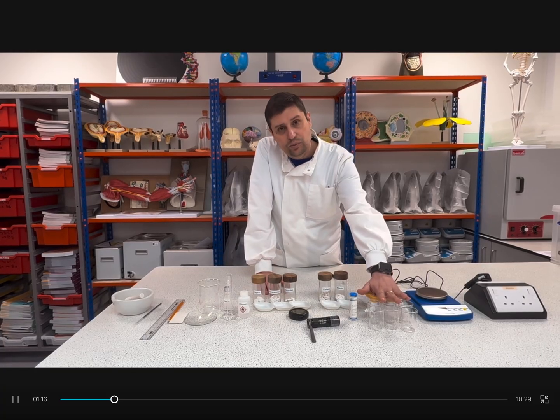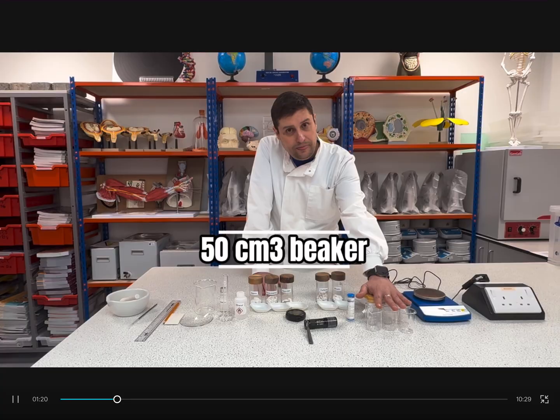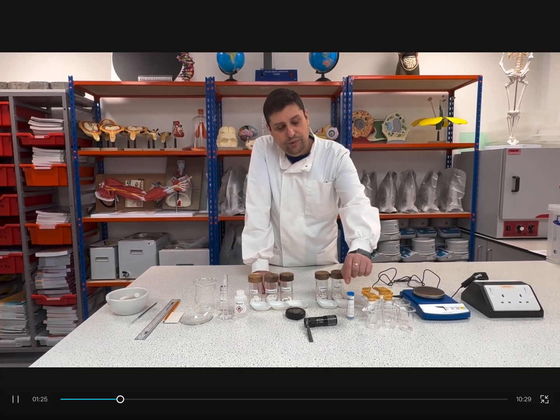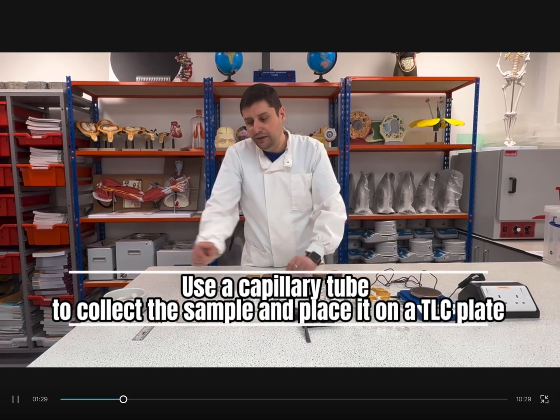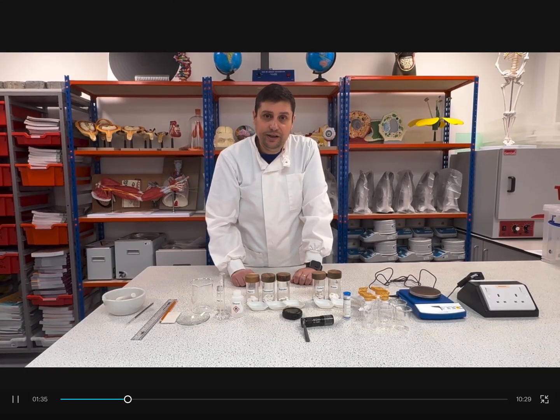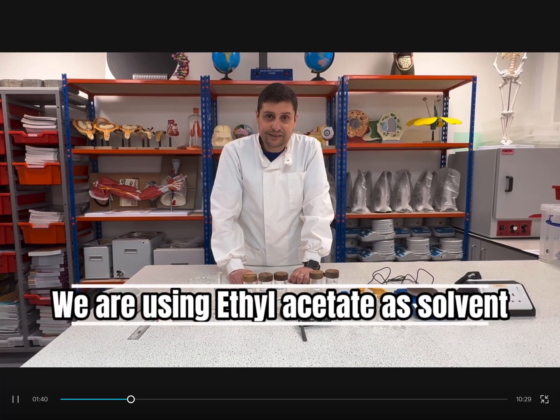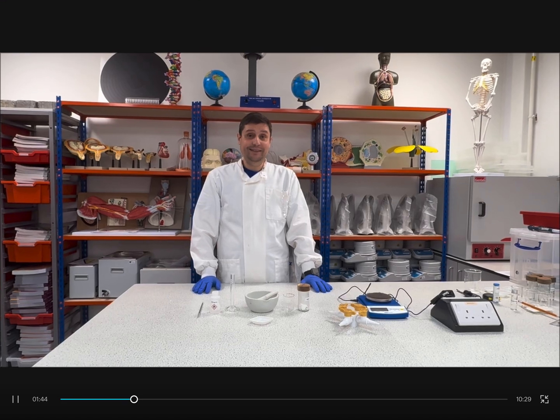For the dilution, we will use different beakers. After all samples are diluted, we will use a capillary tube to collect the sample, place it on the TLC plate, and then run the chromatography itself. Okay, so let's start with aspirin. So let's start the method.